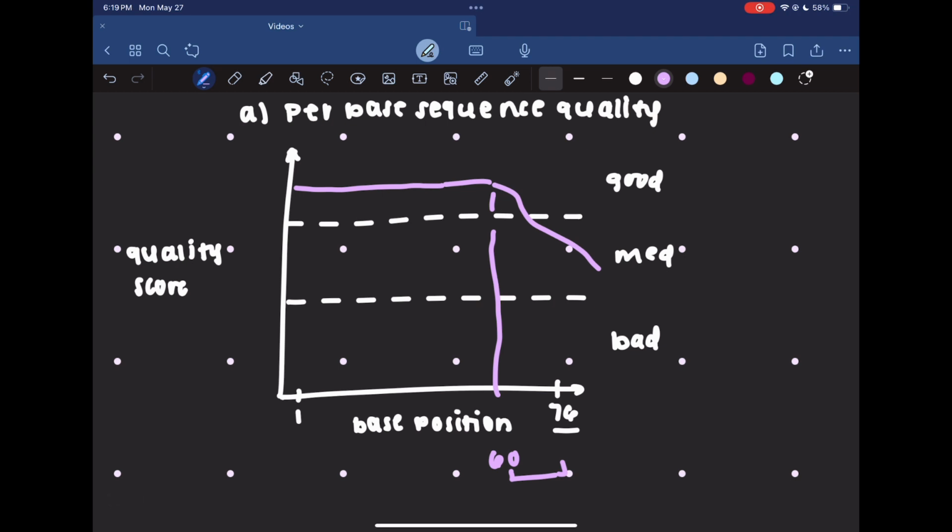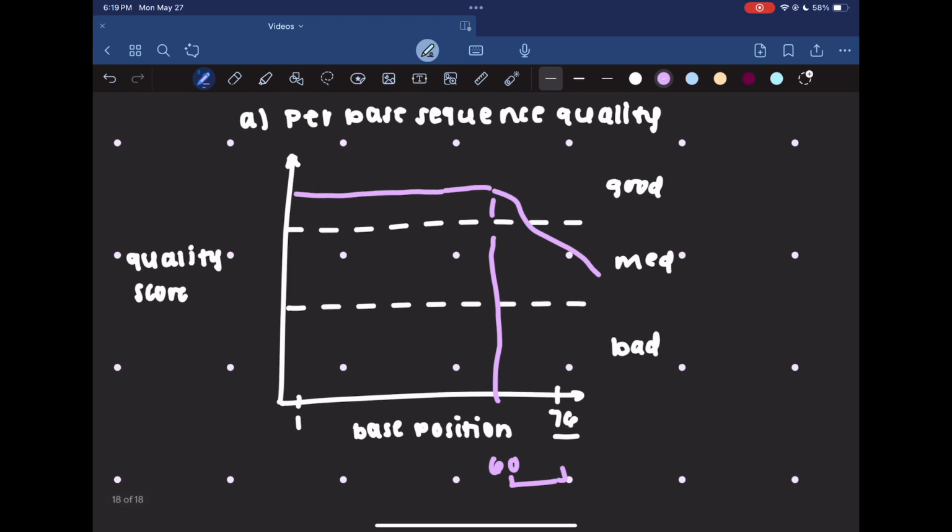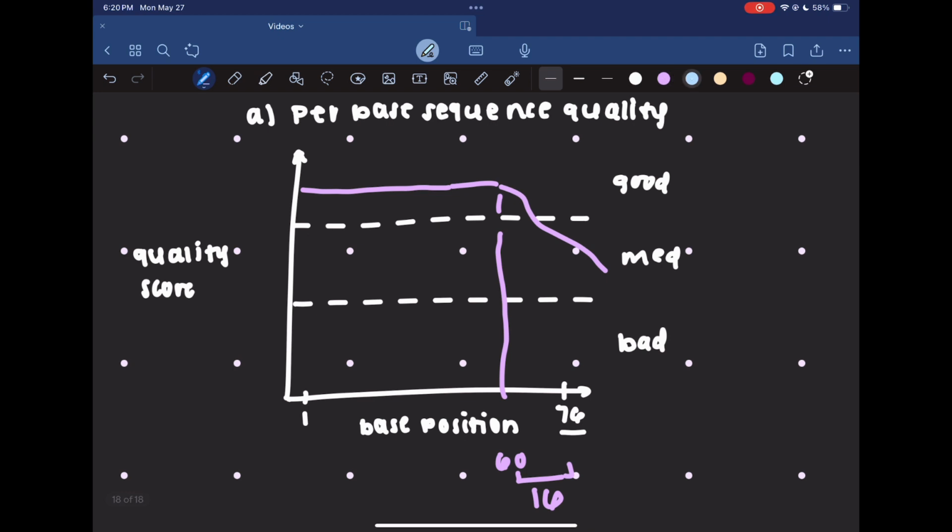But you want to make sure that you don't have a large number of bad quality bases, because again, this quality indicates how confident we are that that is the correct base. So for example, what I'm showing right here, the last 16 bases in all of my reads are poor quality. I don't necessarily want to include those in my future analysis because there might be some confusion of what the correct bases are, and it might start to overshadow my good data and confuse some of the later programs on what the true bases are in those segments. So we might want to check out this graph and potentially proceed with trimming off these last 16 base pairs from all of our data if we consistently see that they are poor quality.